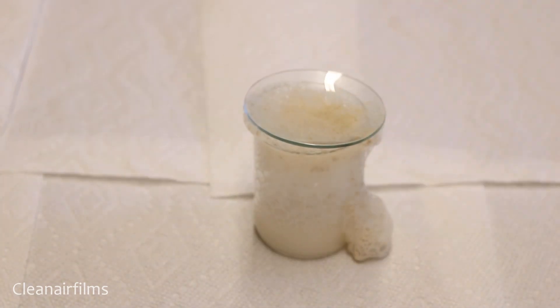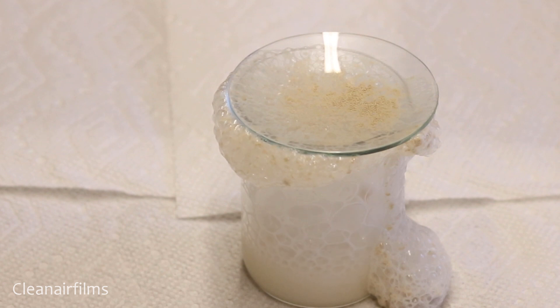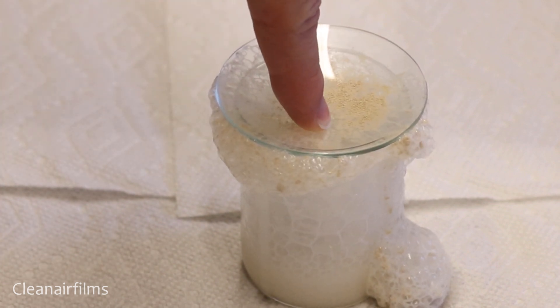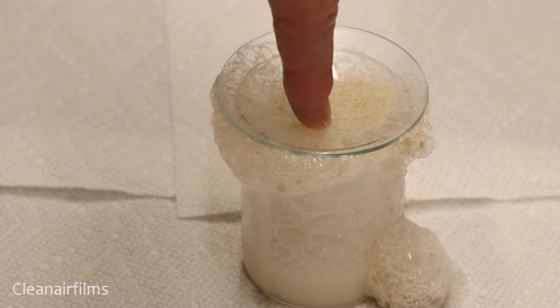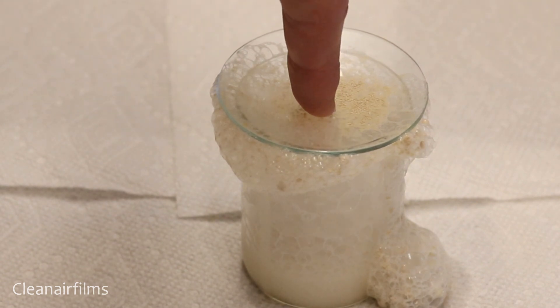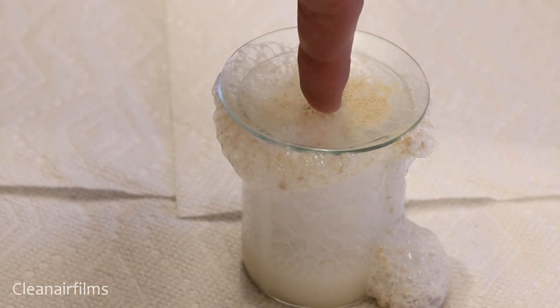Notice what happens. The bubbles that are being produced are oxygen molecules escaping as a gas. This is produced by the decomposition of hydrogen peroxide into water and oxygen.